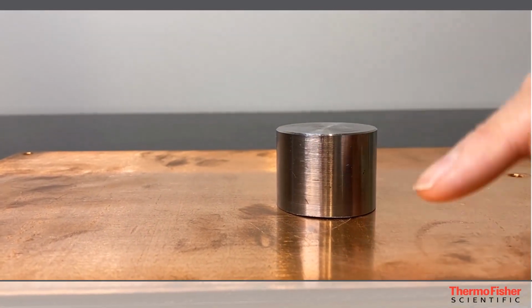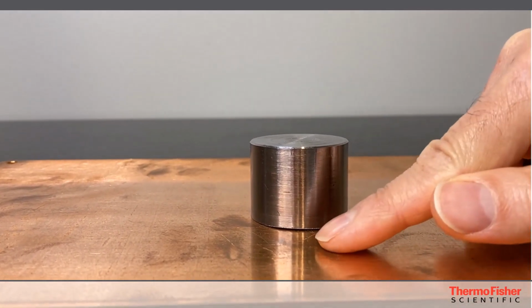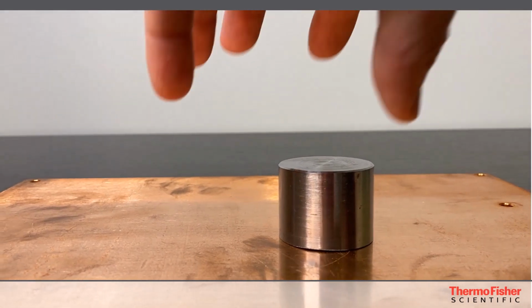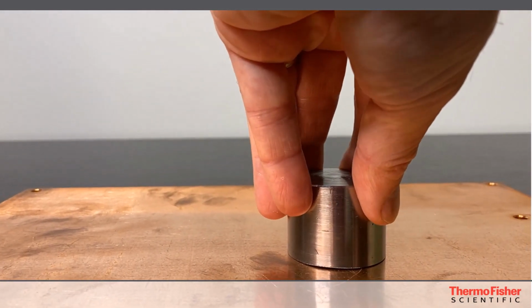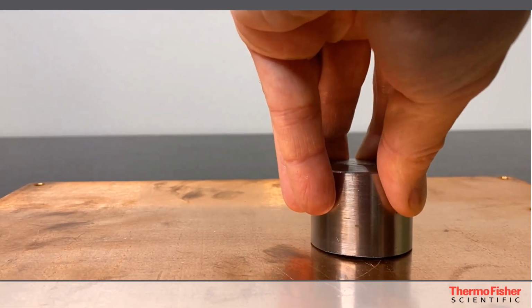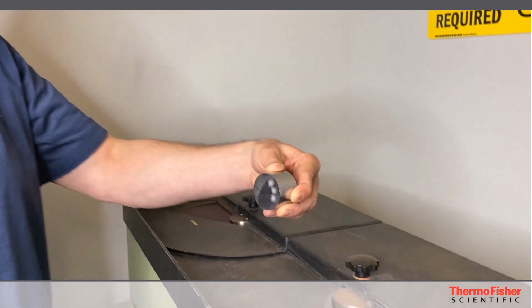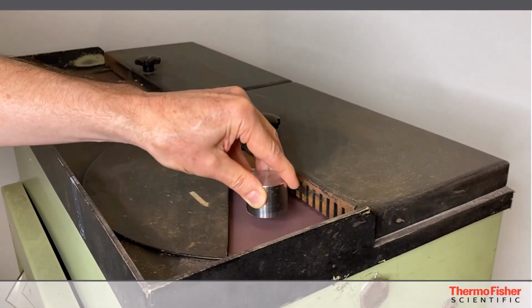So what you want to do, if we want to grind an even surface, is have it at the plane of that gap. So I'll rotate it to this side and then I'll put my hands so that I know where to grip to push down on the back side. Okay, so now that we know how to grip it, and I've got it in a position where I'm going to push down, we're going to grind on the wheel. Remember, the first thing is safety glasses. Okay, so we're going to start up our grinding wheel, and then we're going to grind down on the opposite side.